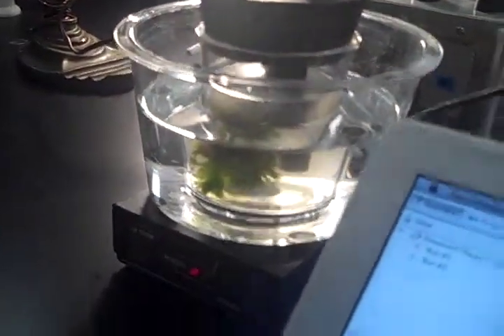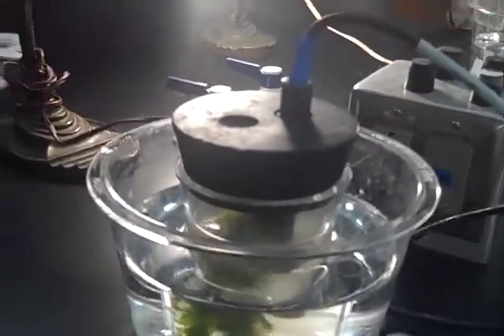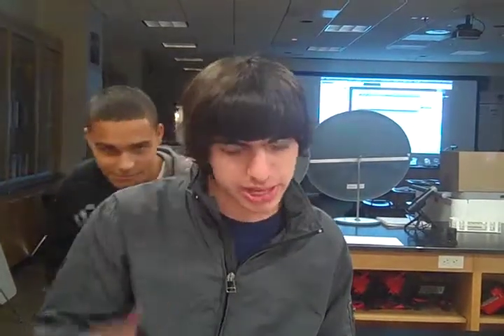As Jared was saying, we have a little plant in there, Elodea, in the middle with distilled water, with a stopper over it to prevent any of the O2 from escaping the experiment, so we can get a valid and accurate response. And we have the O2 sensor on top just to monitor any change in the O2 in the canister. Basically, photosynthesis is when the sun provides the living energy for plants, which is a complex process involving numerous separate reactions. It can simply be represented by this chemical equation right here.